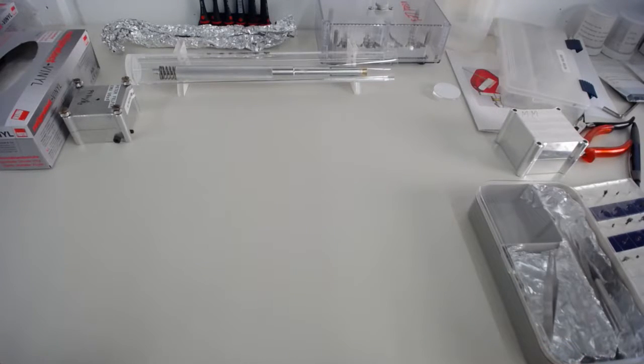And most of all this is about how to work and how to keep your lab environment clean. So the step of taking your sample from your sample preparation to installing them into the atom probe. And in order to do that, we've got a lab bench set up.